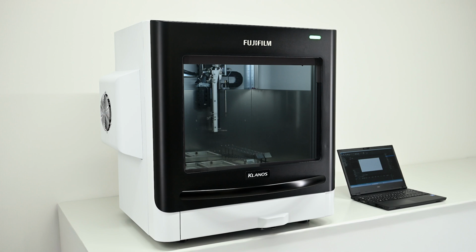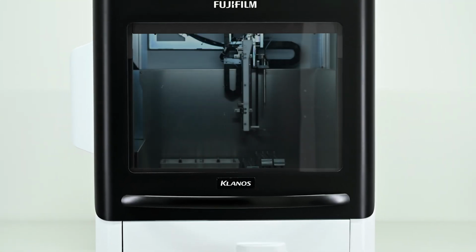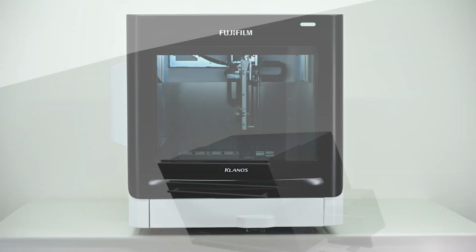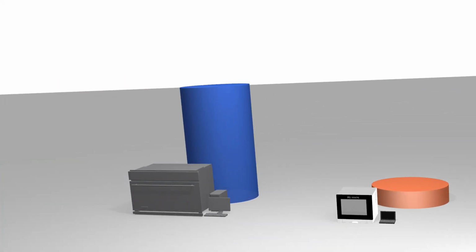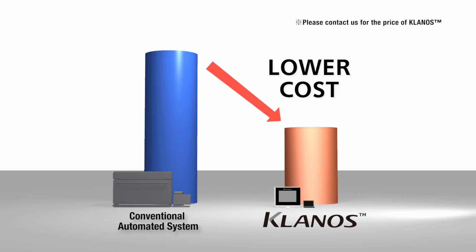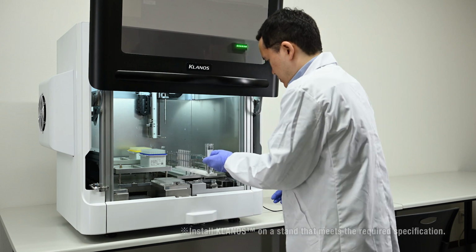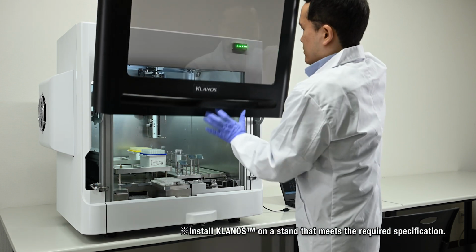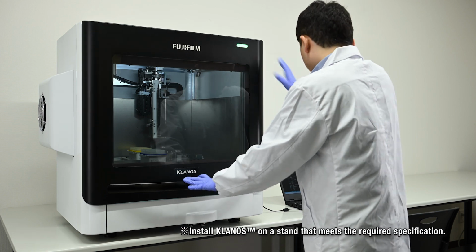First, we will introduce the low-cost and compact design, which are the main features of KLANOS. KLANOS can reduce the cost of installation compared to conventional automated systems. Furthermore, it has achieved a more compact desktop design without reducing the processing capacity of the conventional automated system.